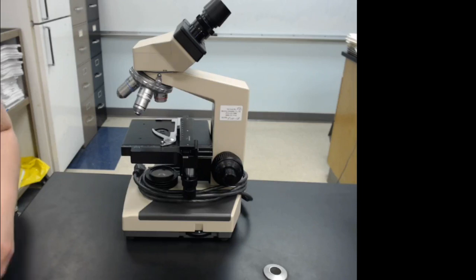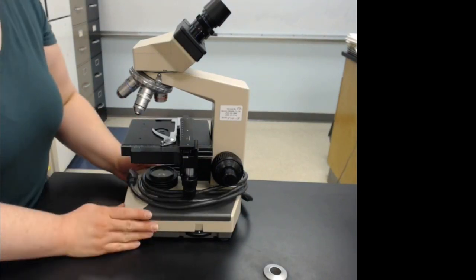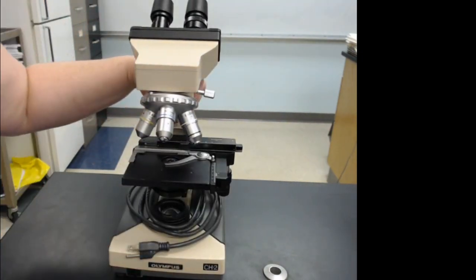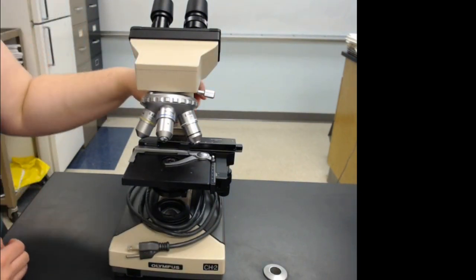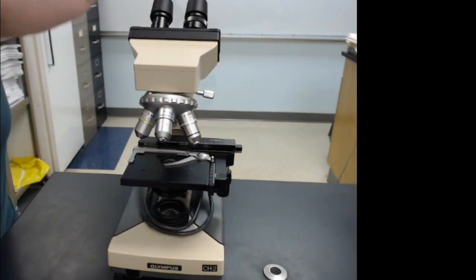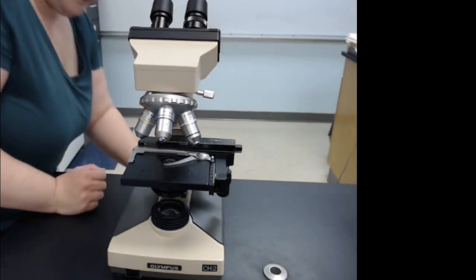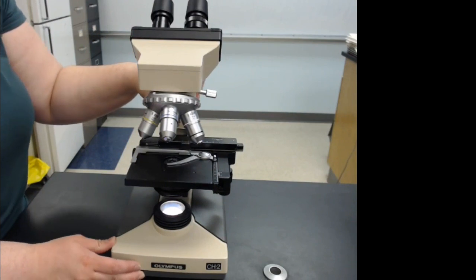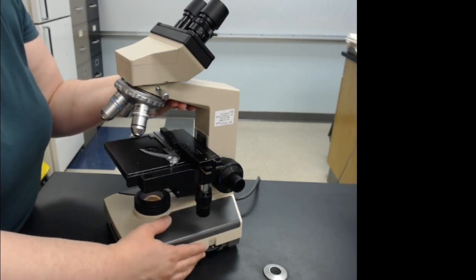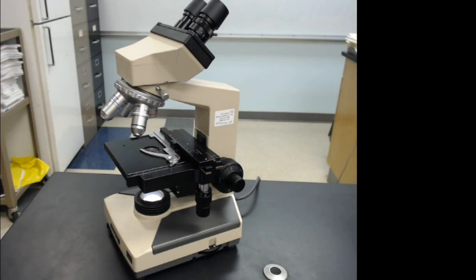Let's list the parts of the microscope starting at the bottom. The base is the support for everything. On the front of these older Olympus CH2 microscopes there is an on-off switch, and the light source can be turned on and off. You can adjust the brightness with the knob here. The mechanics are the same on newer microscopes.